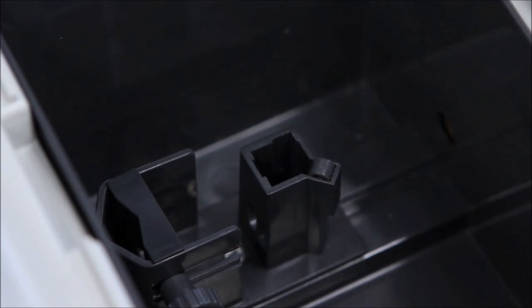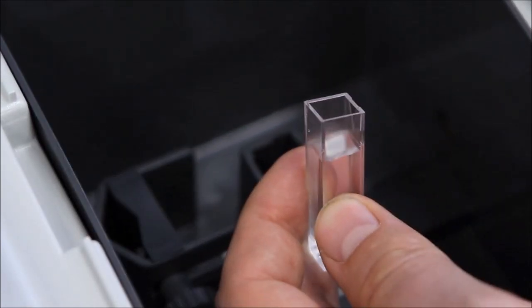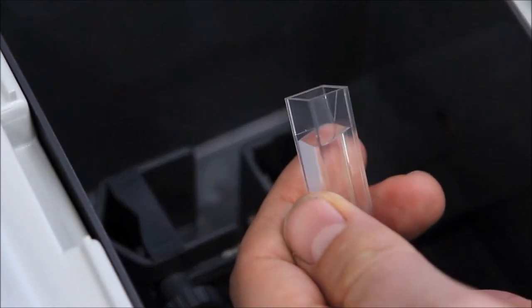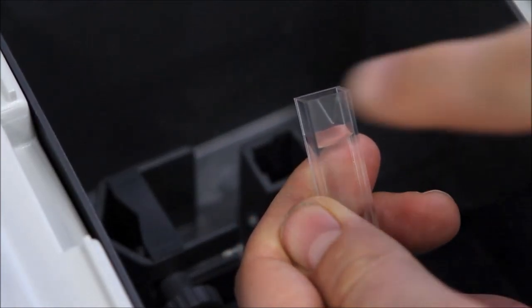Open the sample compartment and place the cuvette in the cuvette holder oriented specifically such that the triangle on one of the non-frosted sides is facing right.